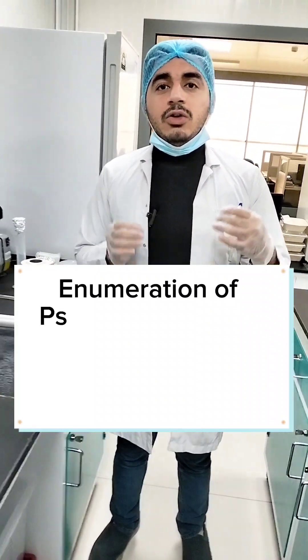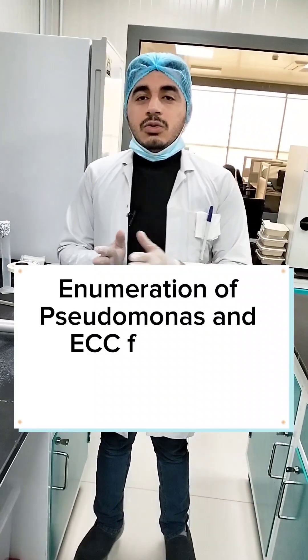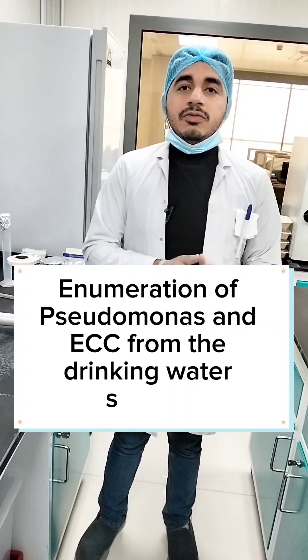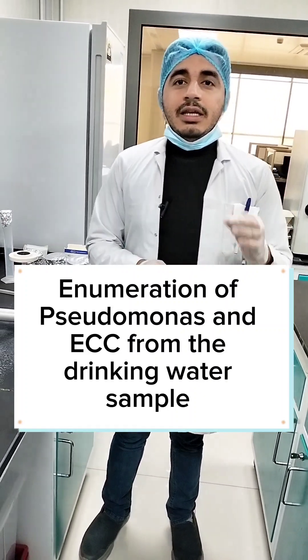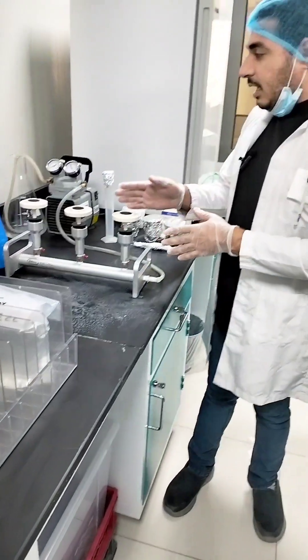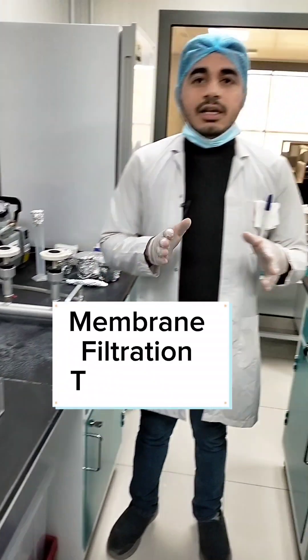Hi viewers, today we are going to detect or enumerate Pseudomonas and E. coli and coliform from a drinking water sample by using a technique called membrane filtration technique.